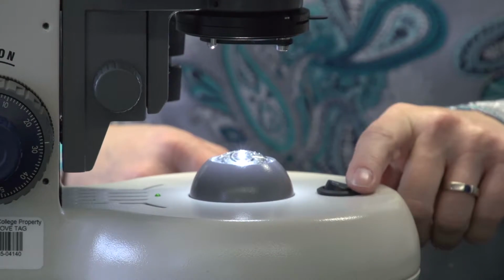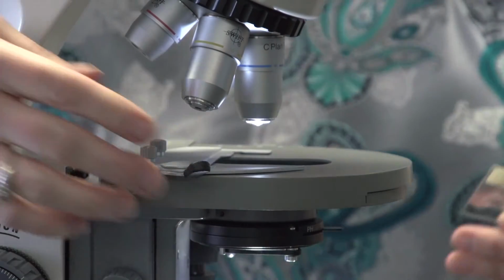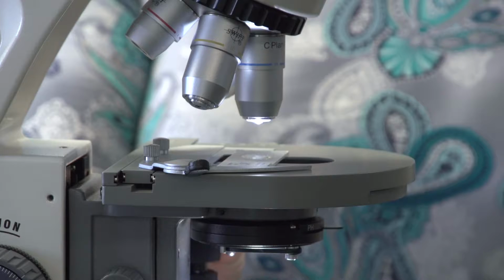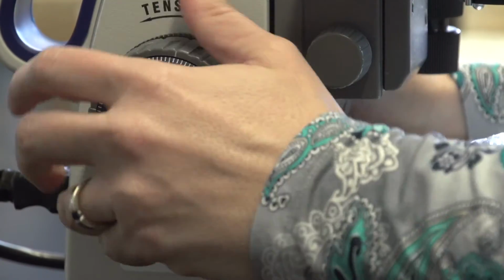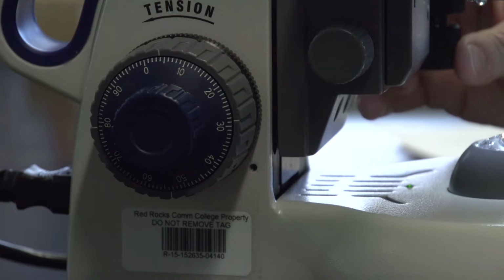So I am going to go ahead and demo focusing the scope on a eukaryotic organism. So we turn the scope on and make sure the light is all the way up. You then take a slide and put it all the way back into the slide holder and move the stage back and forth to focus on the organism. So we'll start at 4x objective. You move the stage all the way up and then slowly move the stage down until you focus on the microbe. Then move the microbe to the very center of your field of view. Make sure it is well focused.